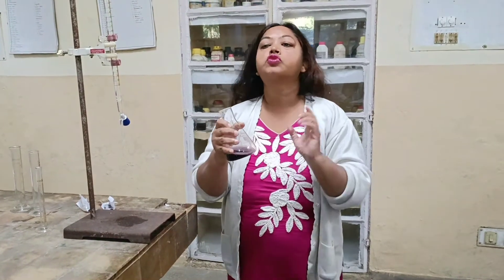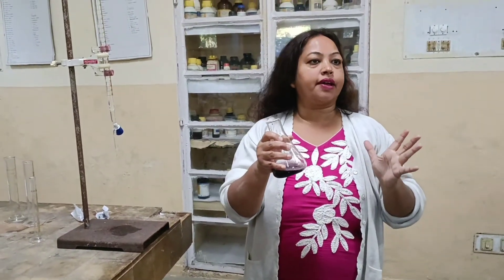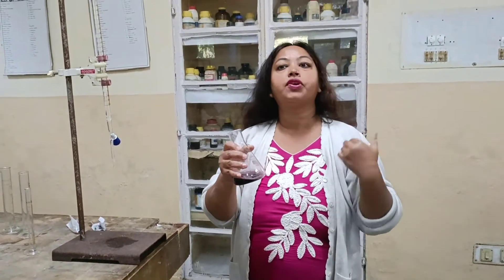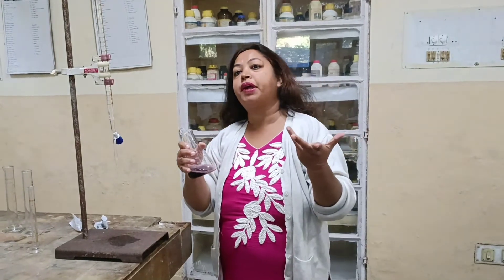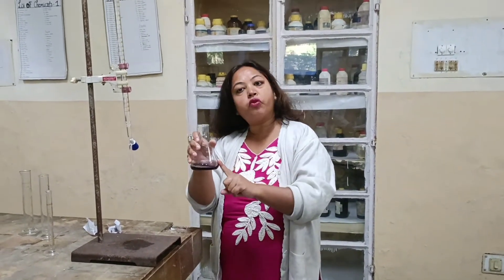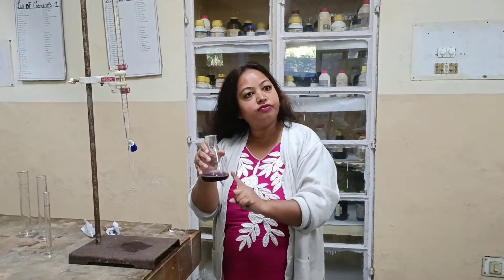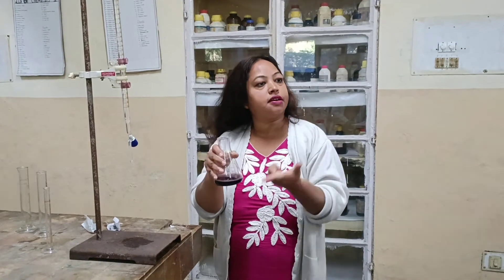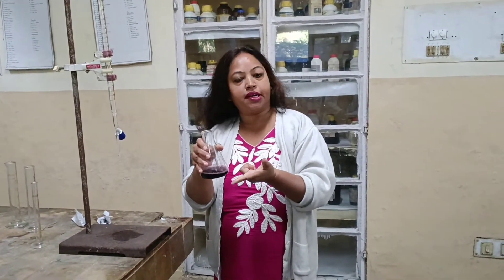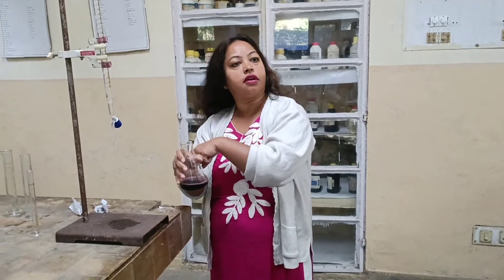Sometimes we also use solochrome black and erio chrome black as complexometric indicators — it depends on which salt is to be analysed. So now we have added the metal in it, which is our calcium. Calcium is the metal and the dye is this calcone.